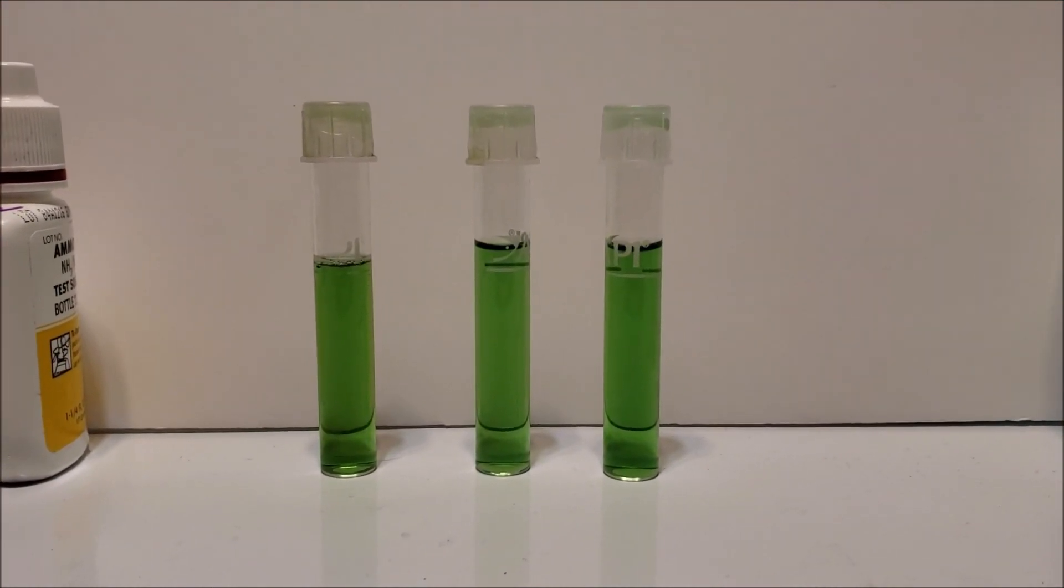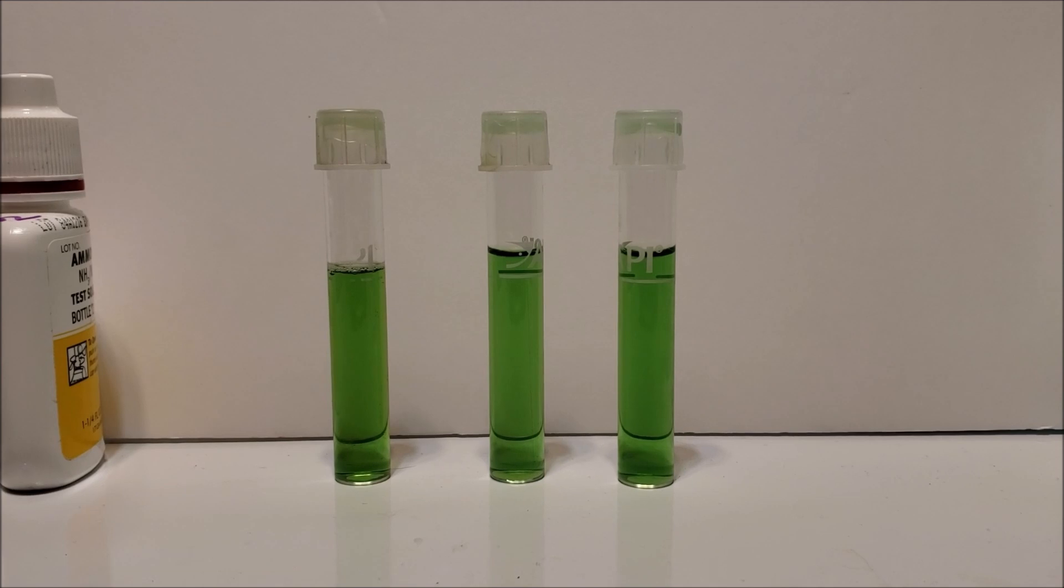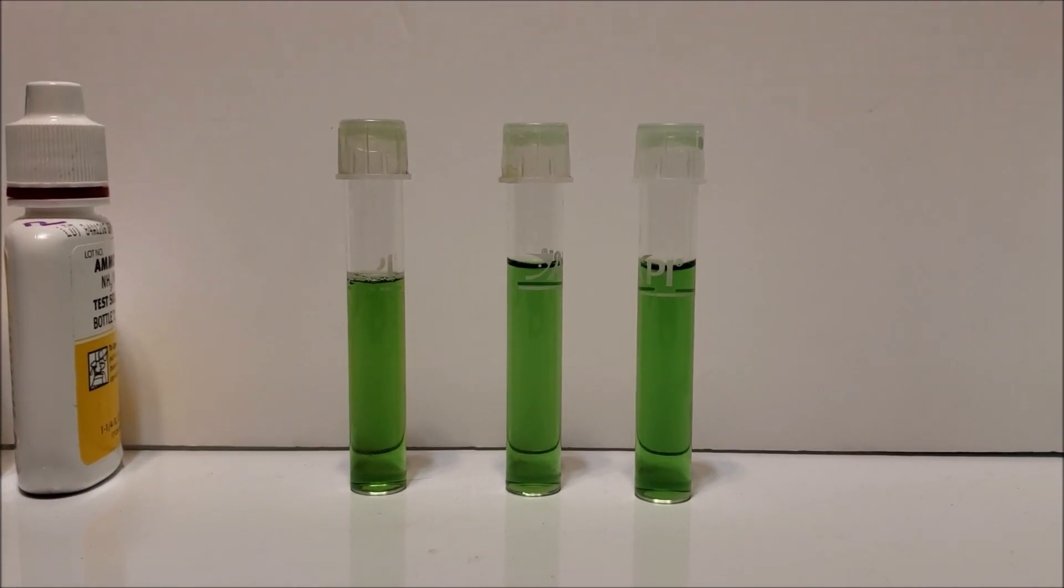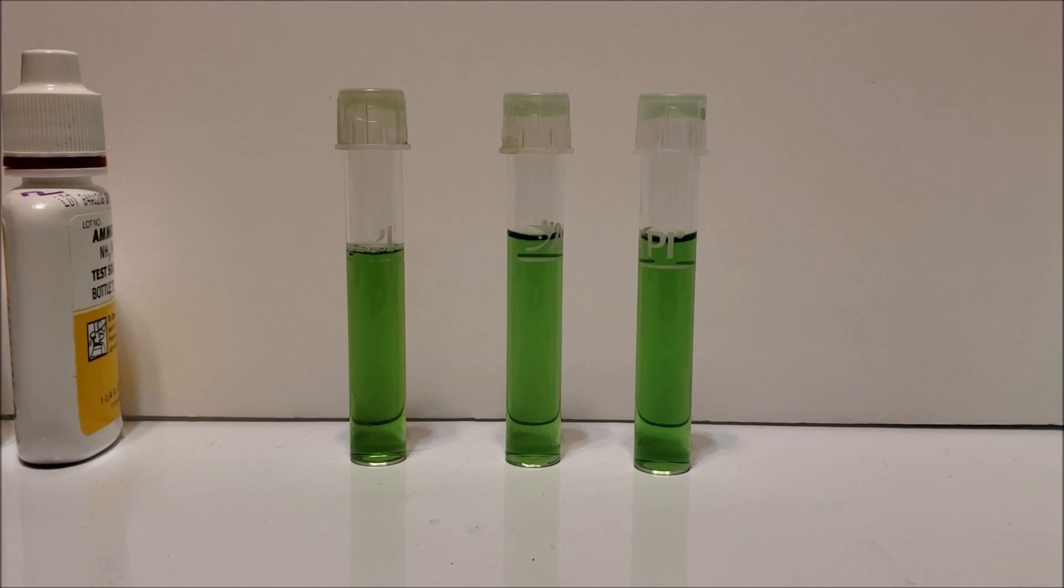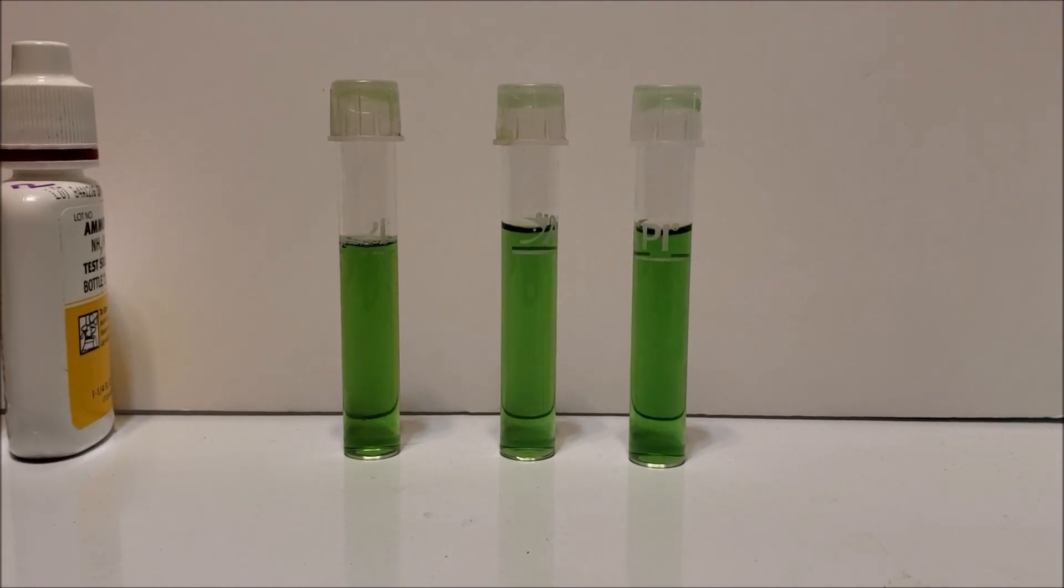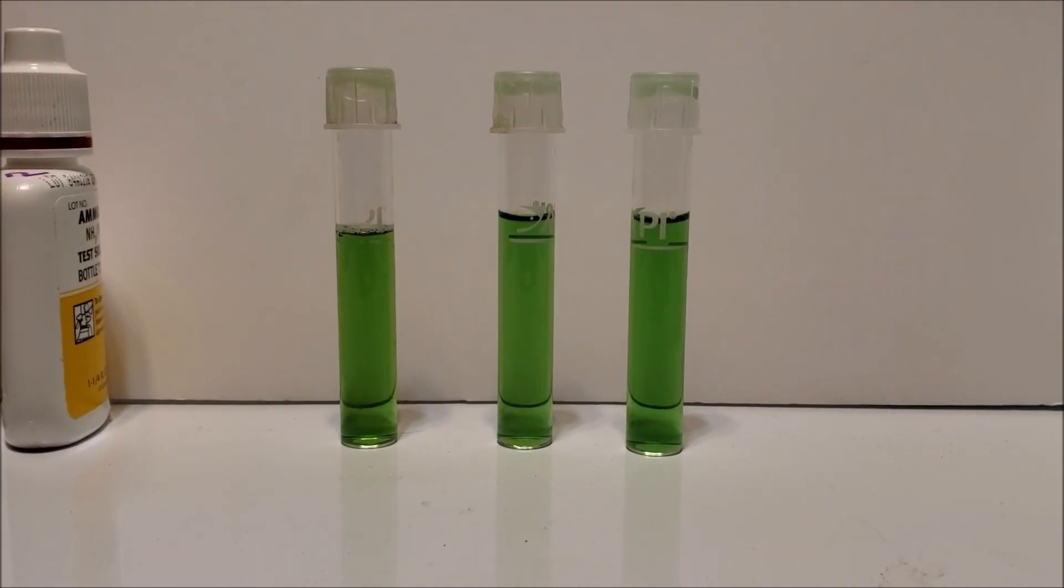Alright. It's been five minutes since that last one was done and they've all had time to blossom into color. And I don't know about you, but I cannot tell the difference from one to the other. I've even held them up to the light against that white card and they are indistinguishable as far as I'm concerned.